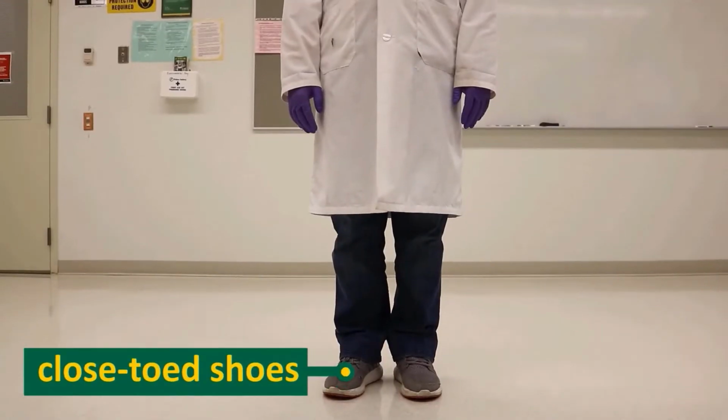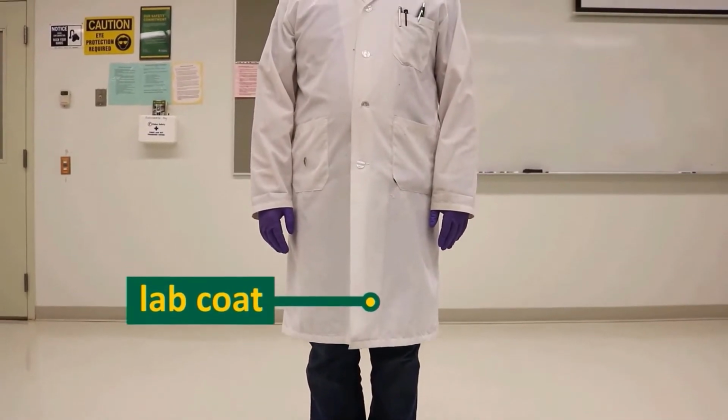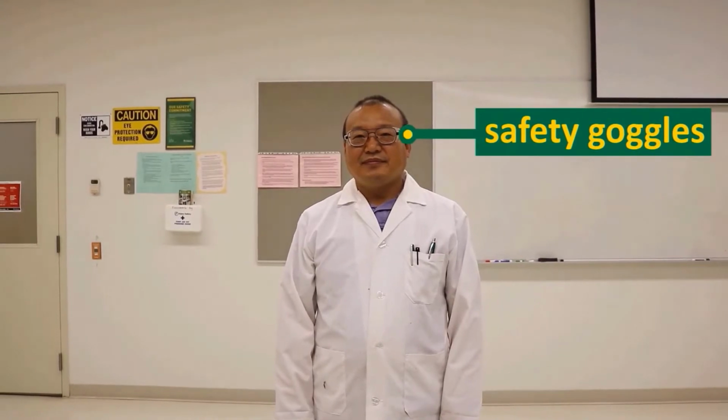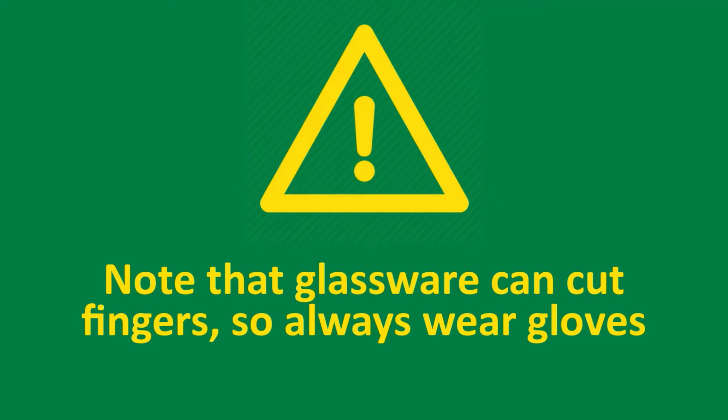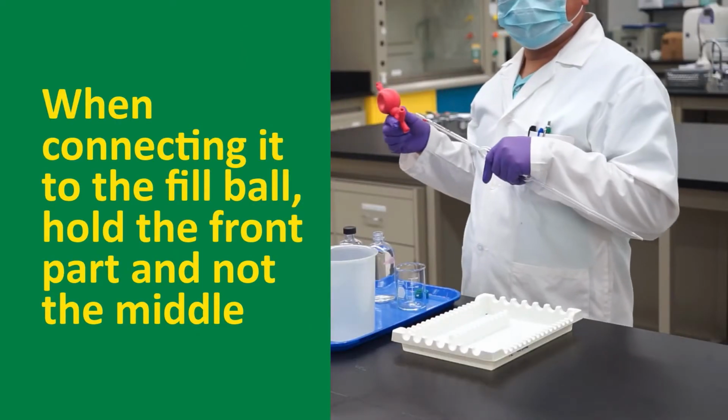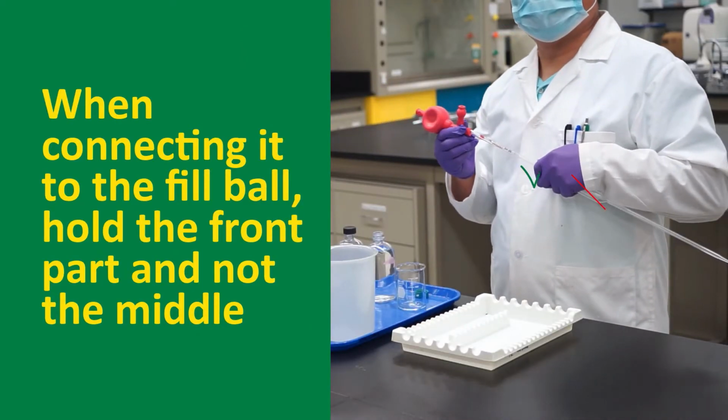Before we start, please wear all required PPE: lab coat, safety goggles, and gloves. Please tie back or tighten any long hair. Note that glassware can cut fingers, so always wear gloves. The volumetric pipette can easily break in the middle section. When connecting it to the fill ball, hold the front part and not the middle.